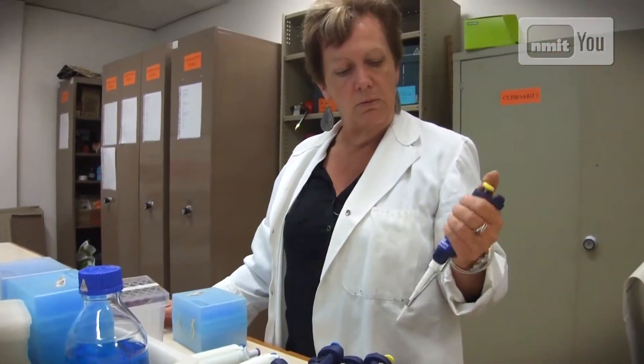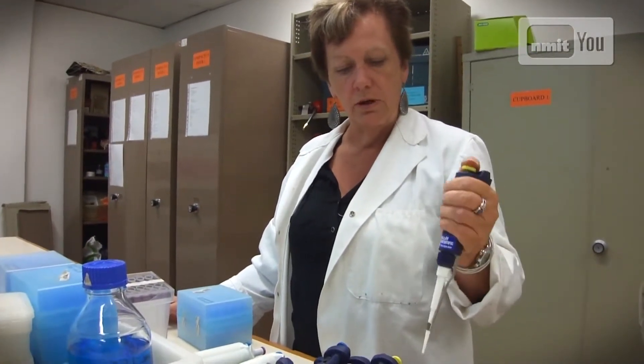What I'm doing now is teaching students how to use a pipette correctly. They suck up fluid and you have to use them in a certain way to make sure that you're doing it properly. It has a clicking system where you go to the first click, draw up your fluid, and then go to the second click to dispense it into something.